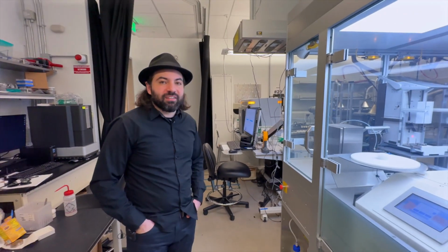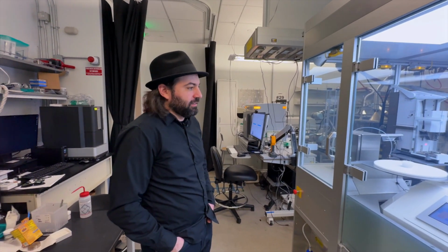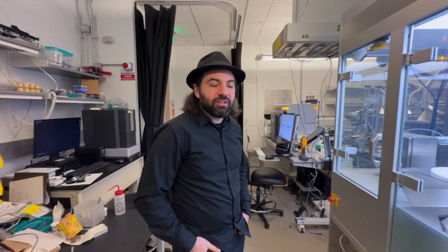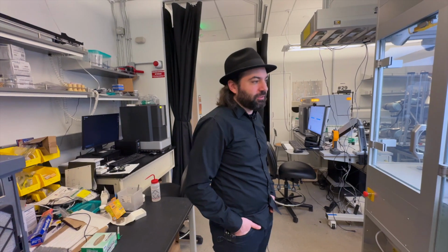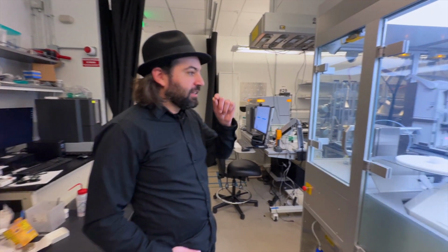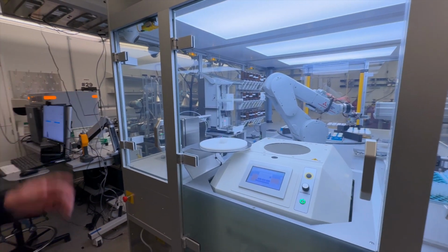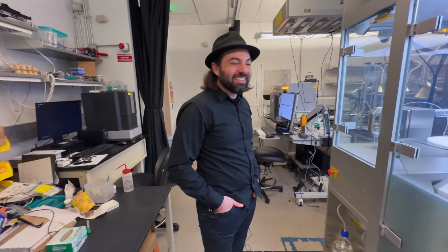The vendors are amazing. We never had any issue. They actually do a great job on everything. So whenever we need support, they're always there. Since I'm here, we never had any issue that I can recall on anything. And then Labman, for example, that made this for us, they understood the assignment. And as you can see, this looks amazing.